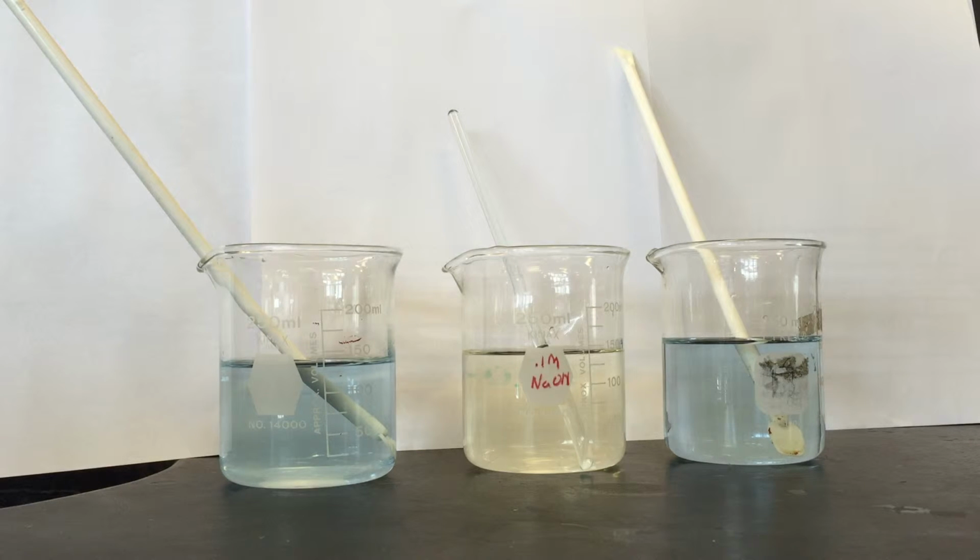We then added some sodium hydroxide, and in about 19 drops, the color of the solution changed from yellow to blue, showing that sodium hydroxide is indeed a base. This also indicated that a small amount of the base is needed for the reaction to occur.